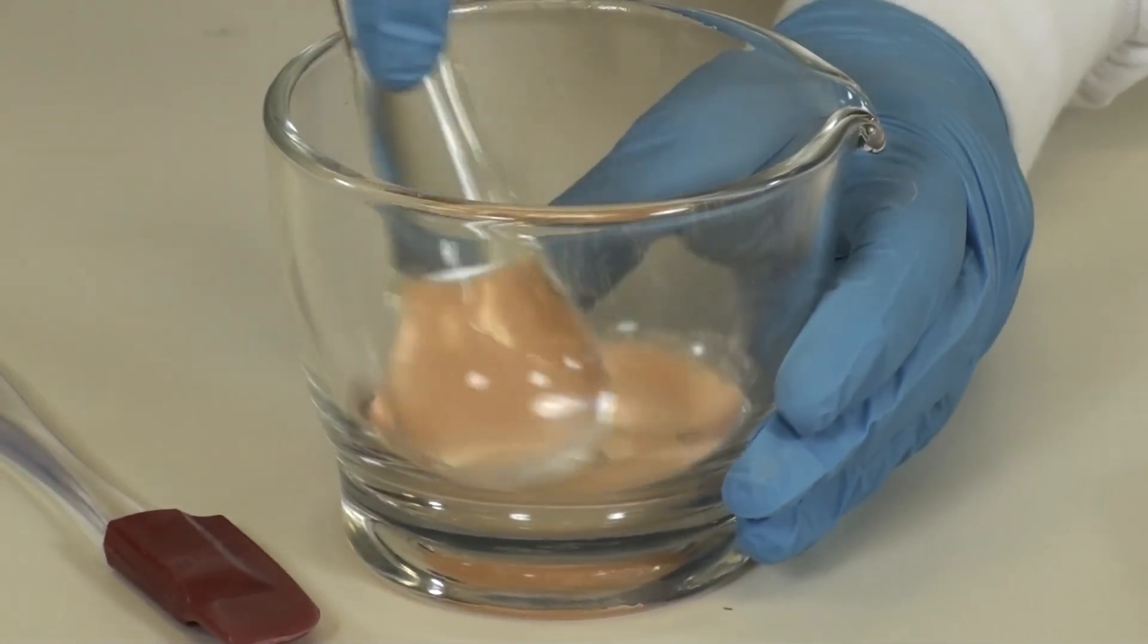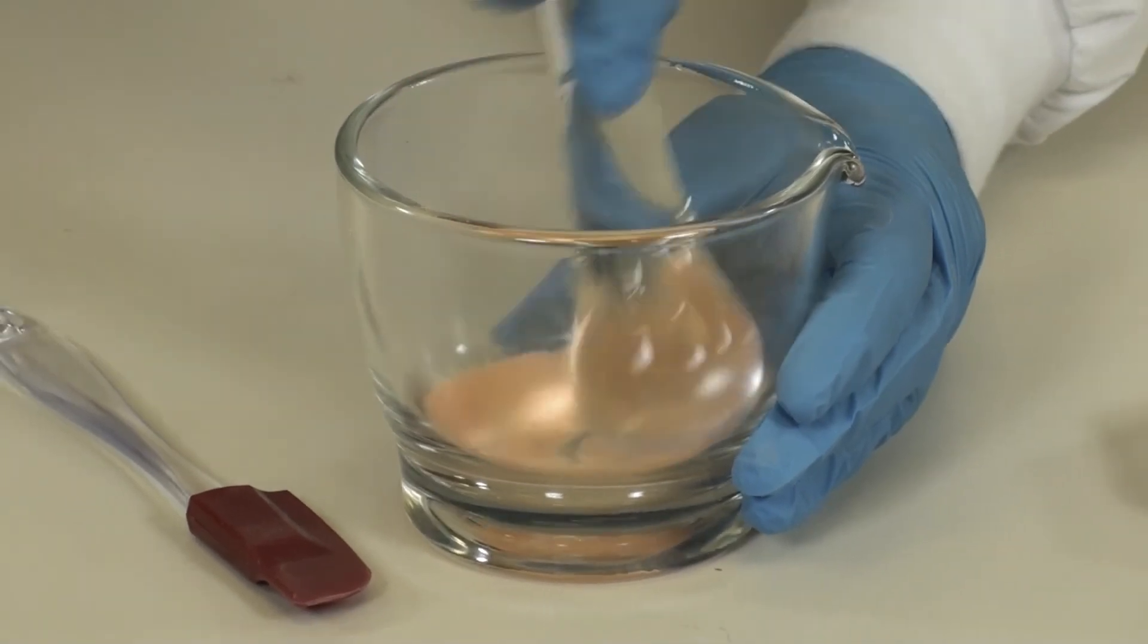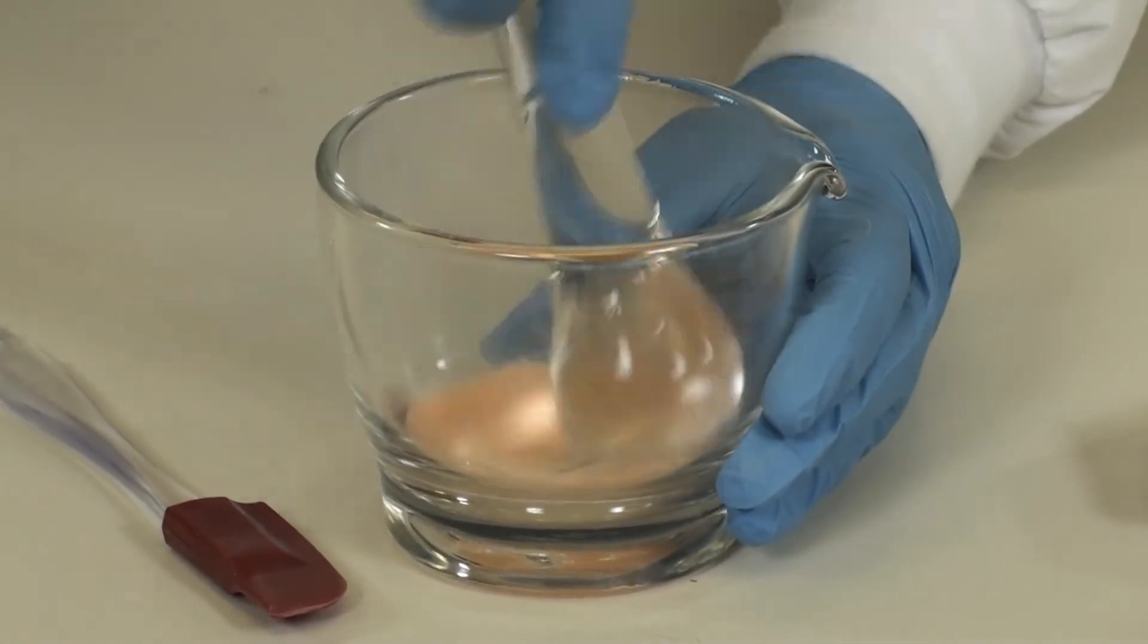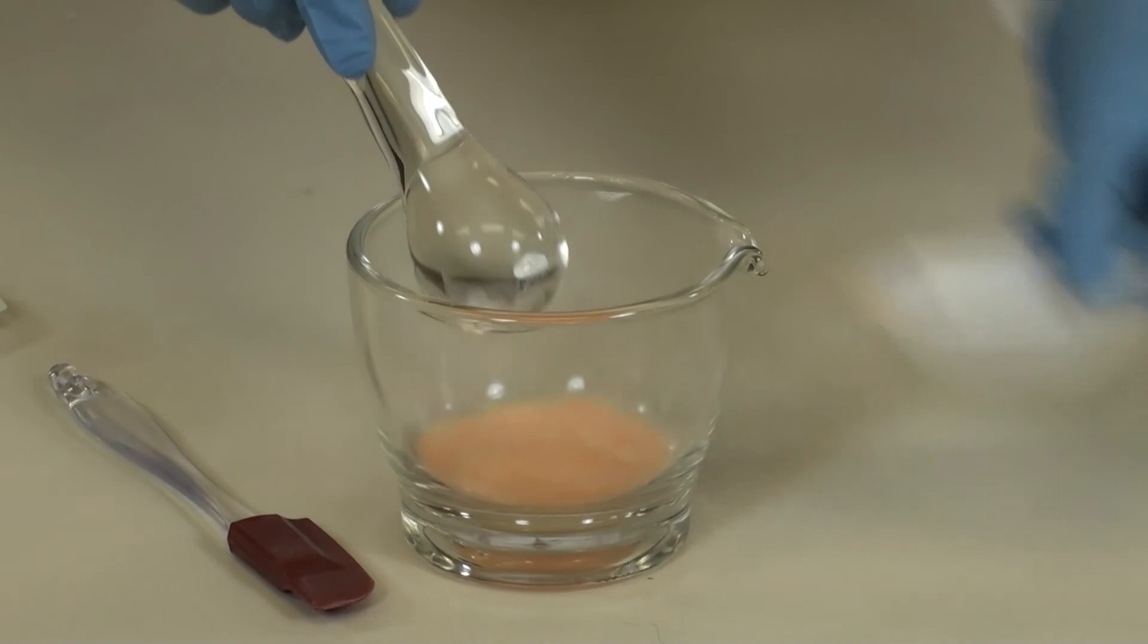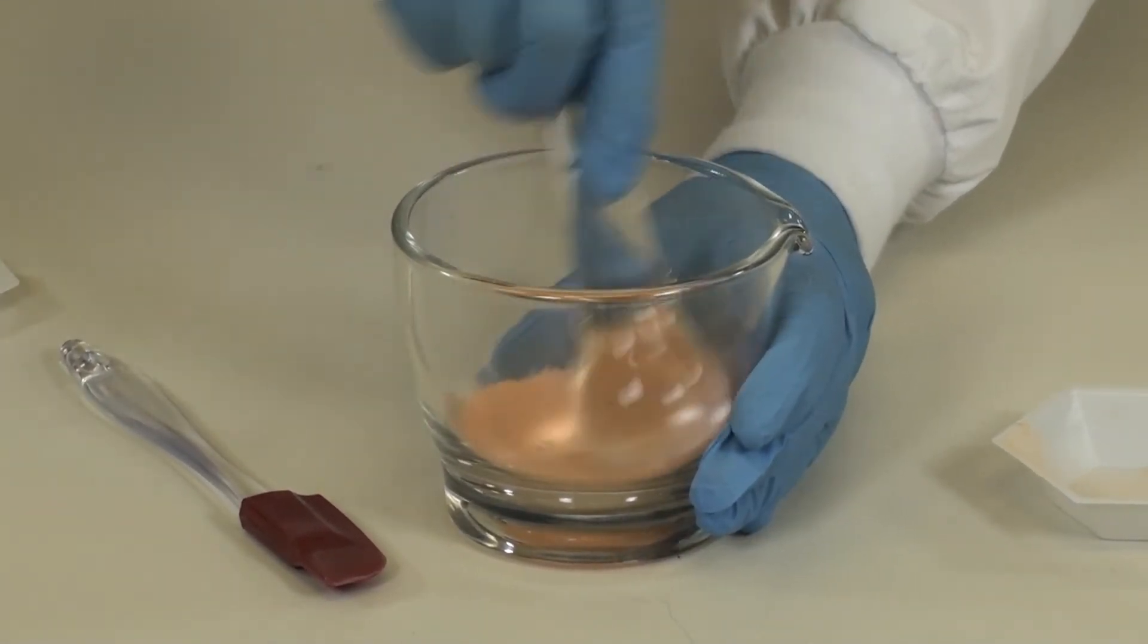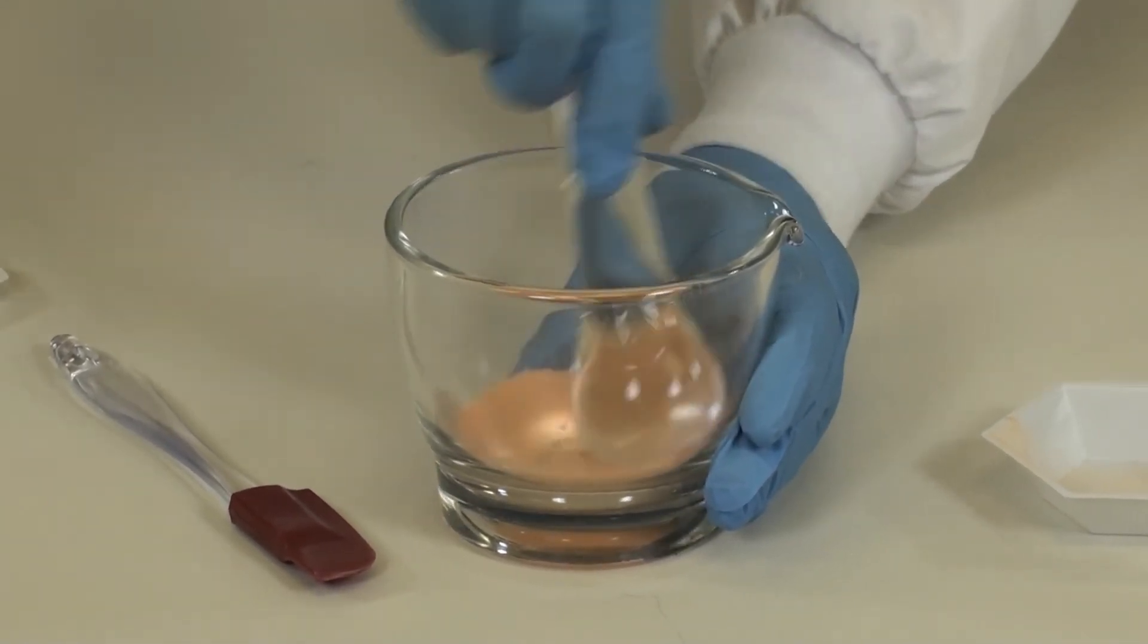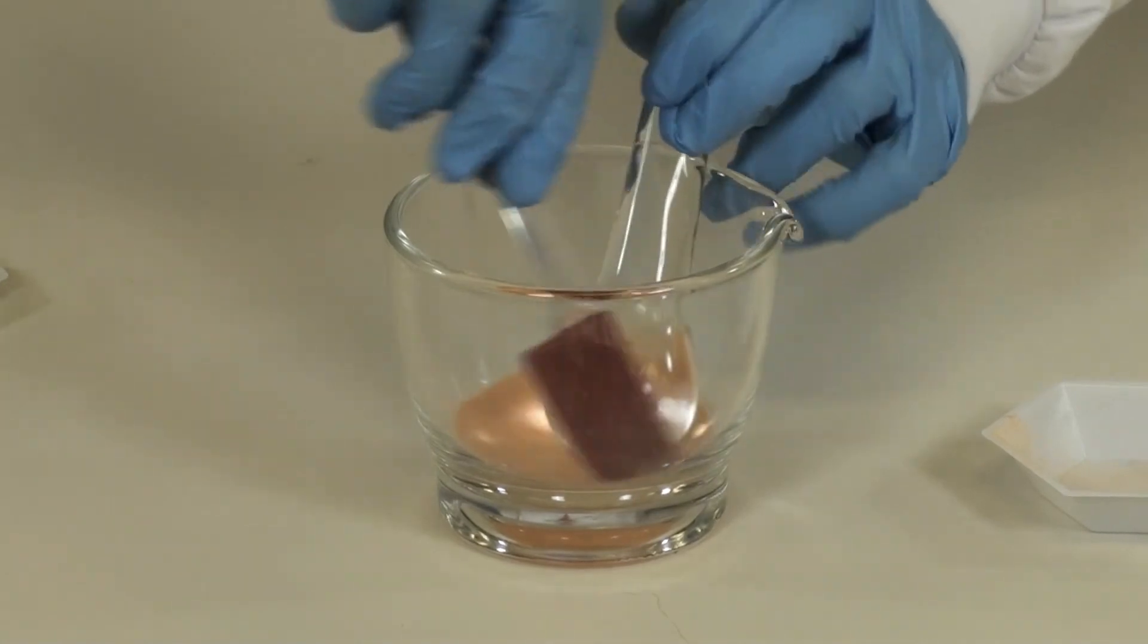These powders are already very fine powders, so forceful trituration is not needed. Your end result will be a uniform, fine powder mixture. Again, if you need to scrape down the powder, use your rubber spatula.